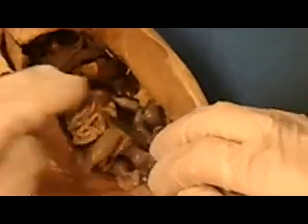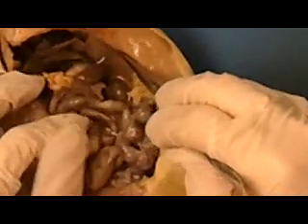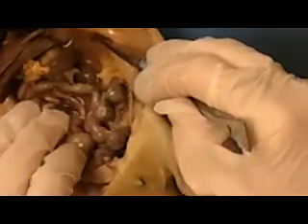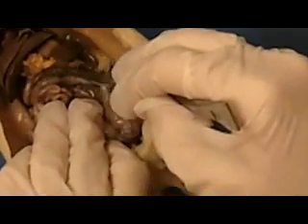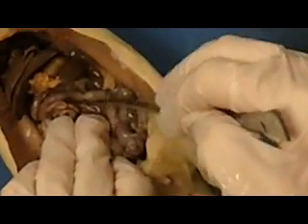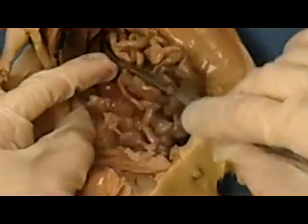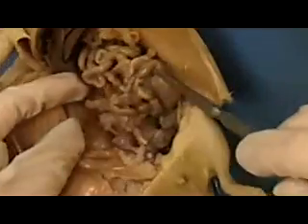Now, the easiest place to see the large intestine is to pull all of this back out of your way, and then if you will look for the cane shape, then that's the large intestine. So the cane shape toward the back is the large intestine. Now if you lift the rest of all this up, there's a kidney on this side on the left, and then if you flip to the other side and look underneath the liver, you'll see the other kidney.